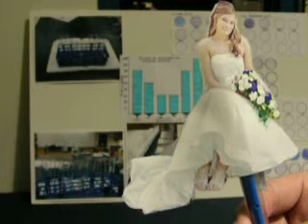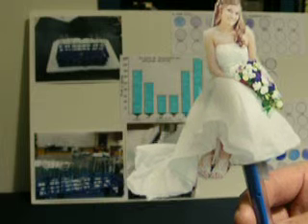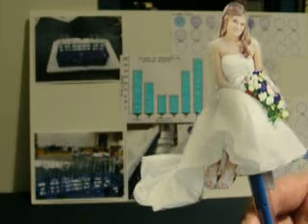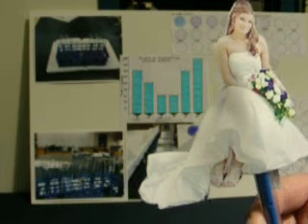We also placed a set of test tubes of amylase and starch in ice water, which was 2 degrees Celsius, and a set at room temperature, which was 21 degrees Celsius. We left them approximately 15 minutes to heat up or cool down within their environment.